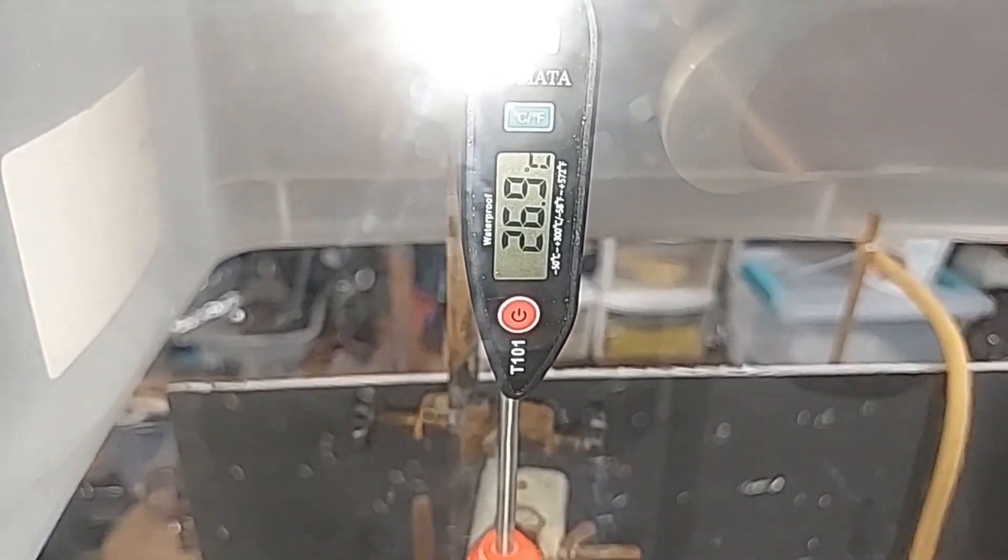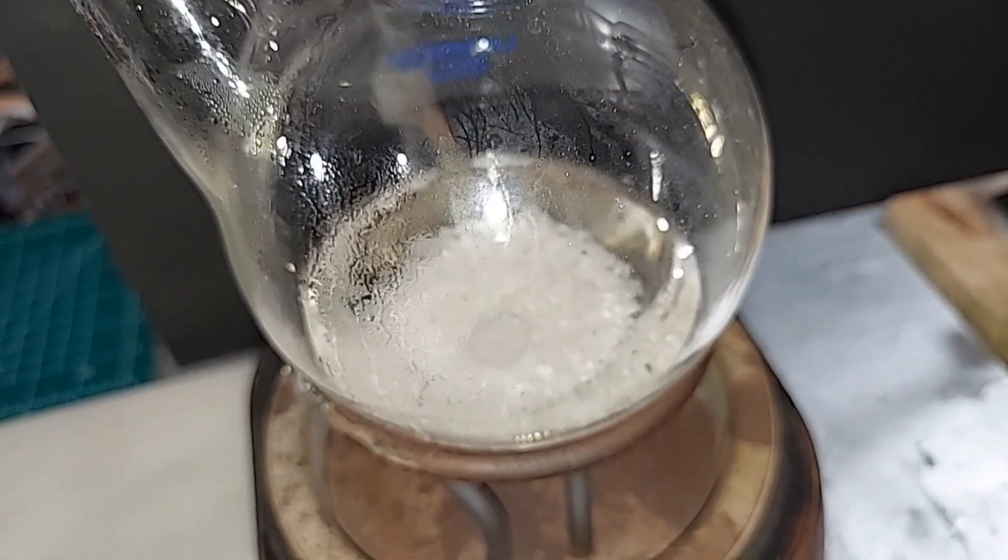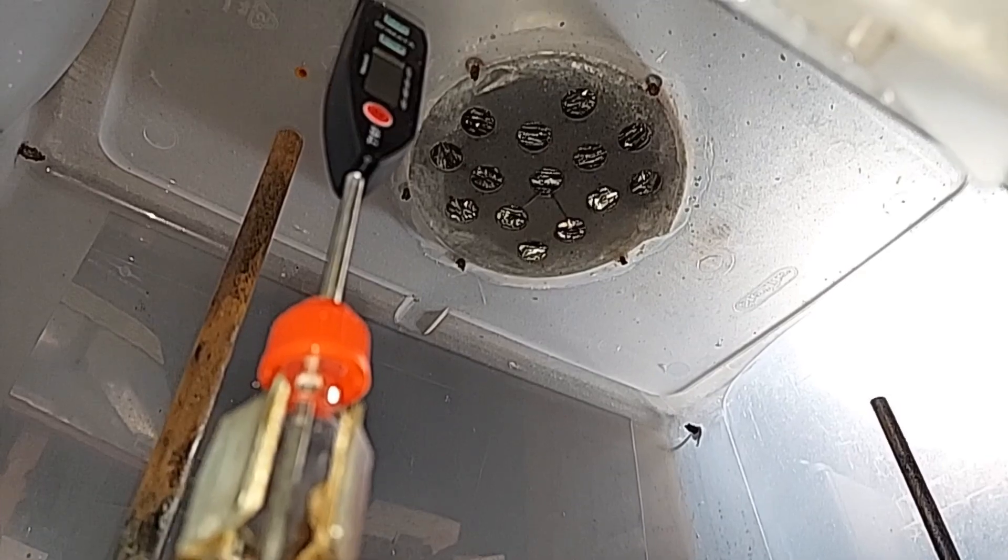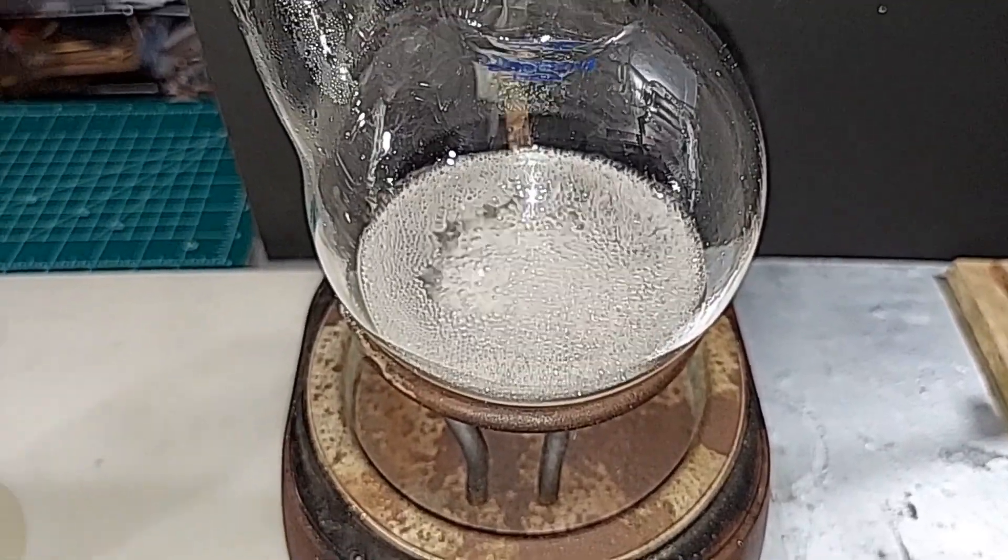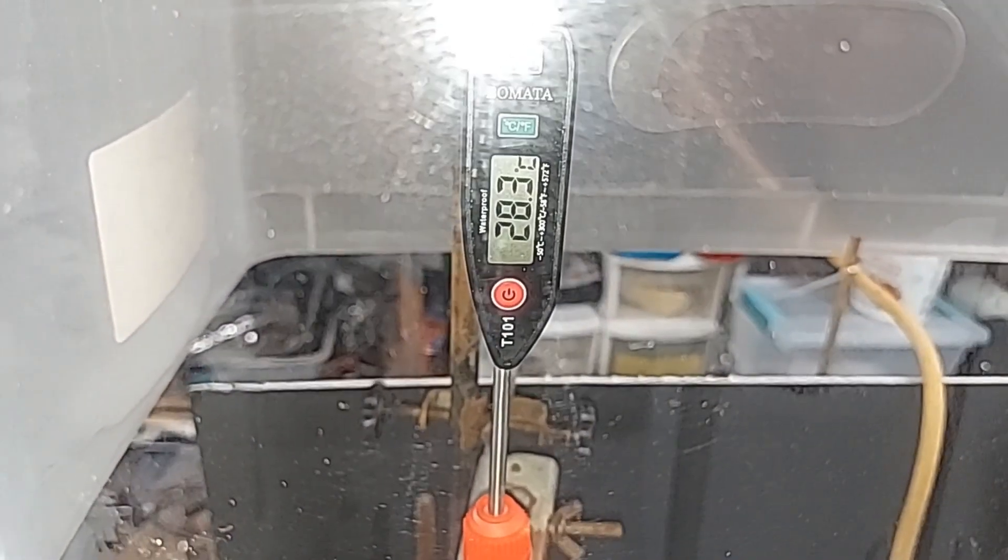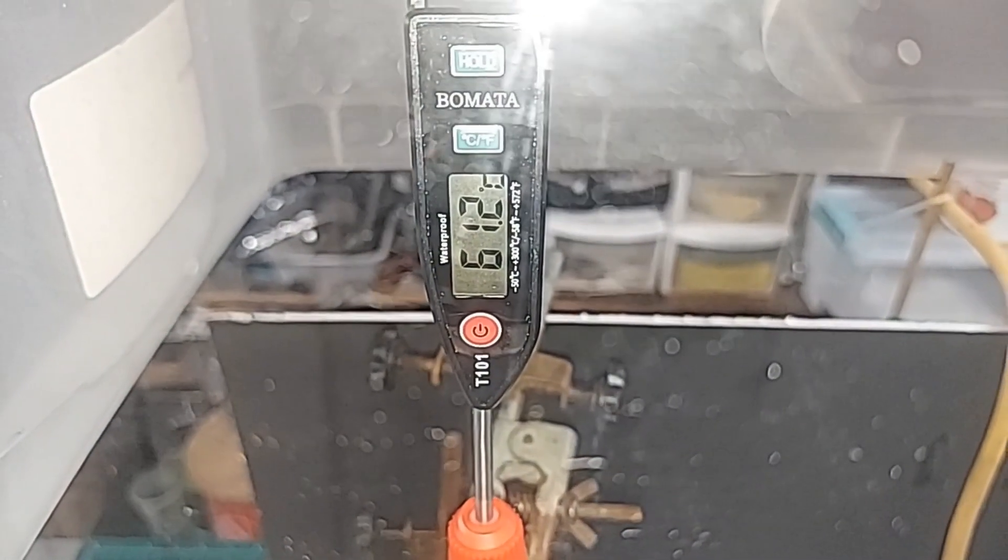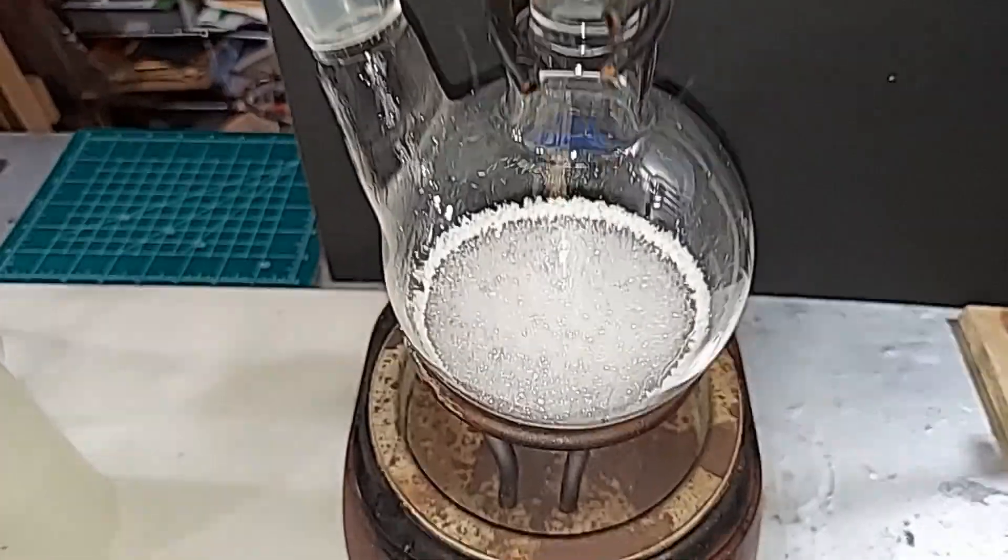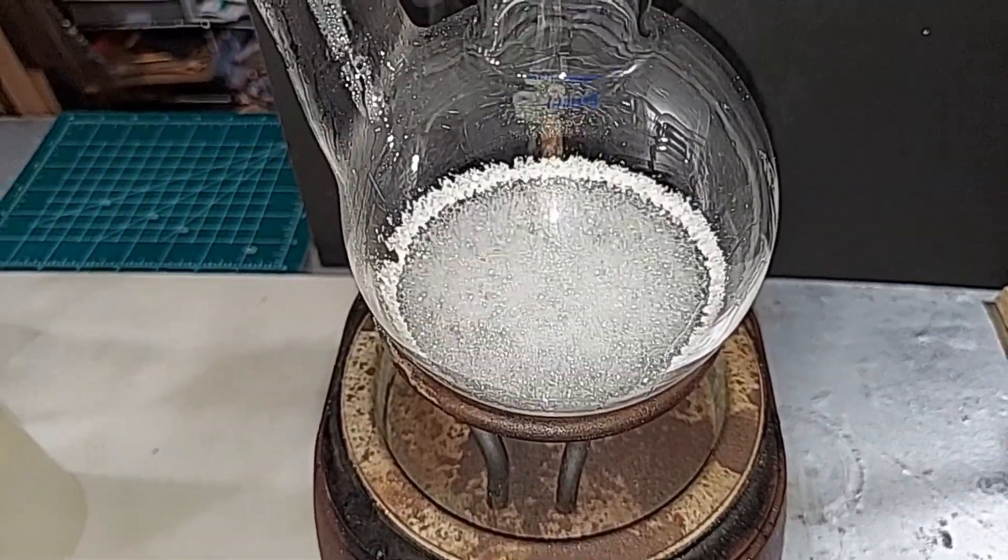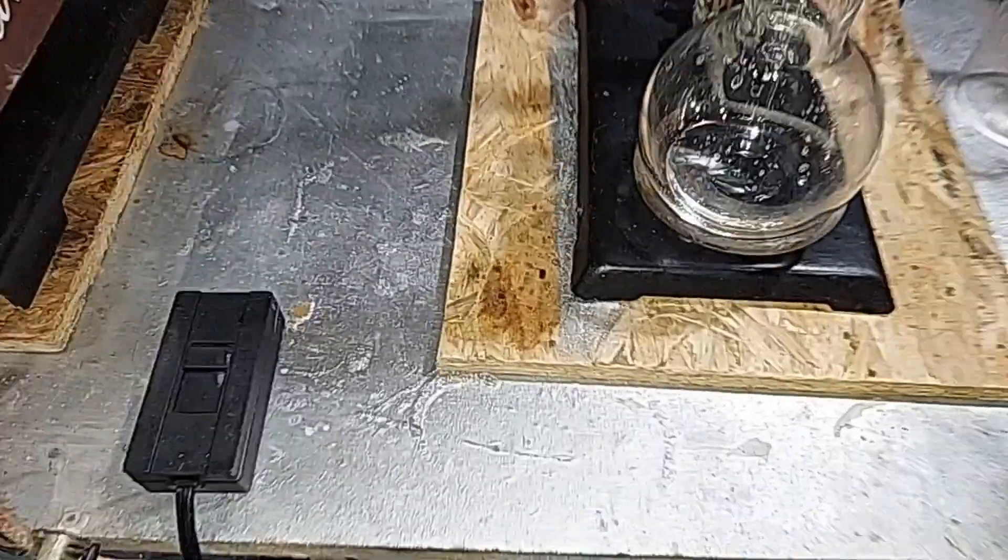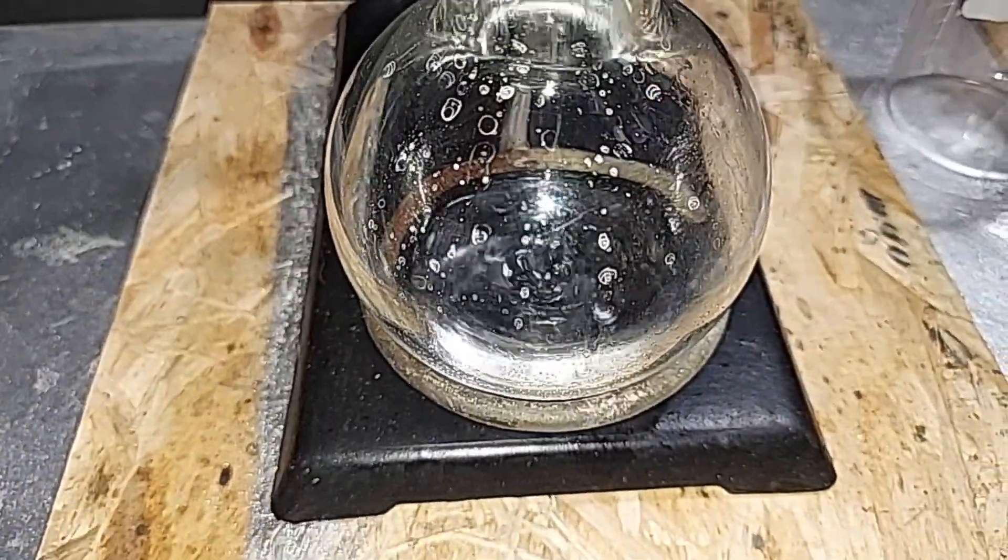The chloroform is just starting to boil, and I've got my fume hood on, of course. There's a pretty vigorous boil going on with the chloroform right there. This has not risen that much yet, just a couple degrees Celsius, but we're looking for that right temperature before it starts to drip over. Here we've got the right temperature, plus or minus the error of the thermometer. This is boiling aggressively. You can see the calcium chloride being left behind there in a ring, and on this end we're collecting our pure chloroform.